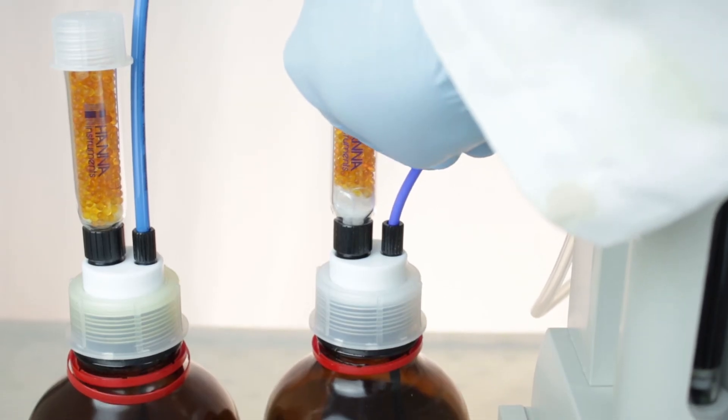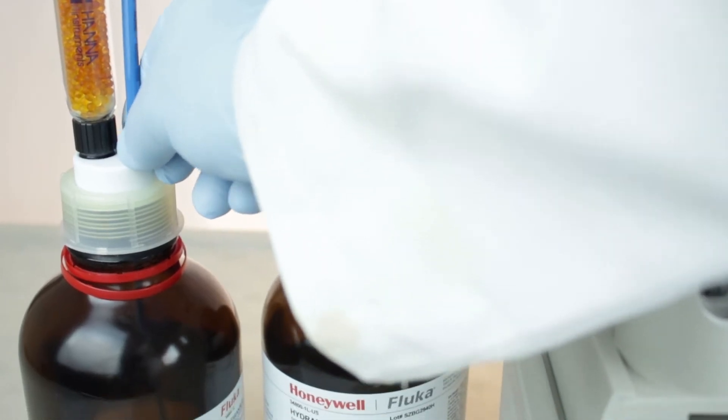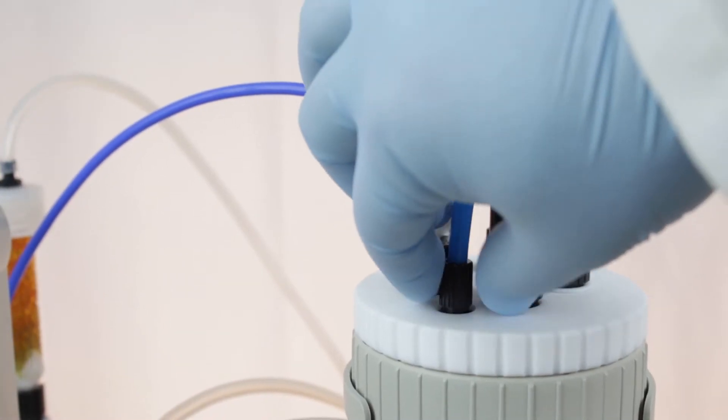Make sure your burette aspiration tube is securely connected to your titrant bottle and your burette dispensing tube is securely connected to your titration cell and dispensing tip.